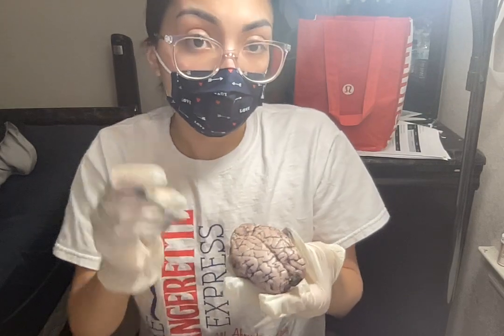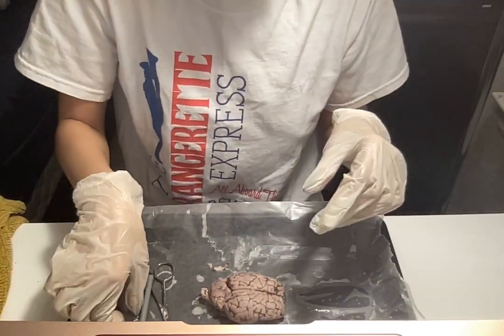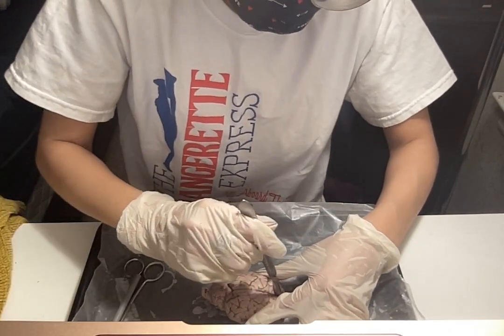All right, so I'm going to go ahead and slice the brain open. So kind of just put that there. So I'm going to start cutting it.